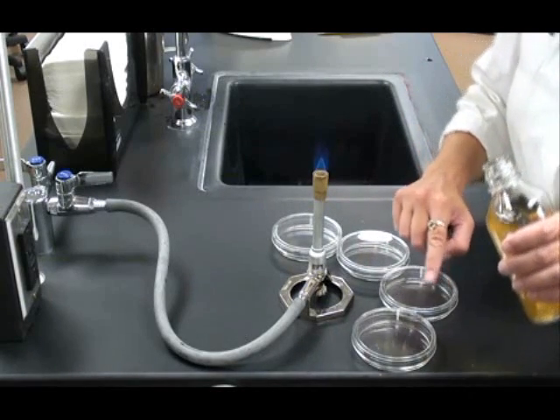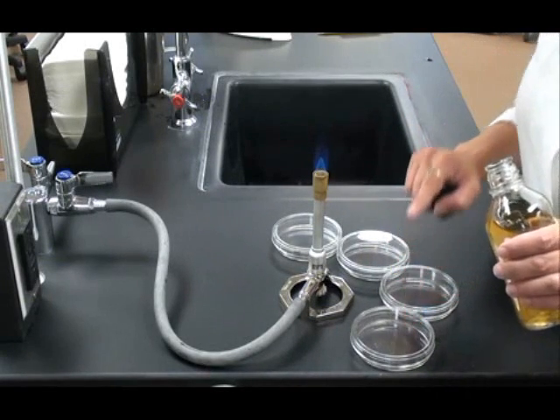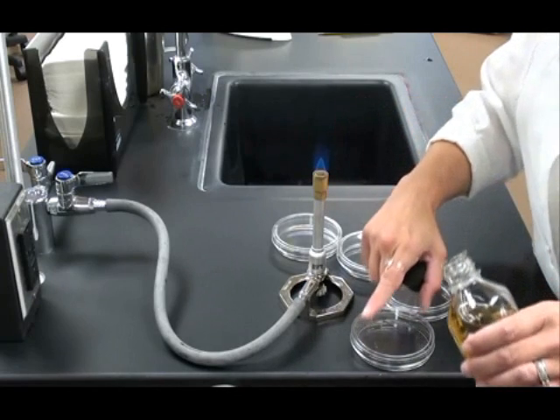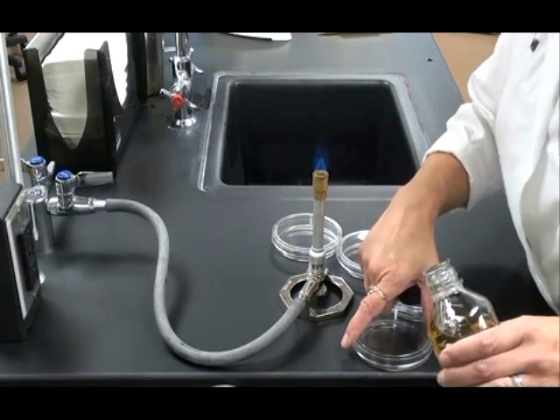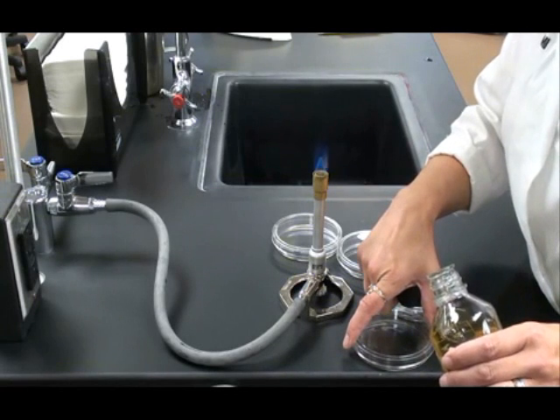Make sure your petri dishes are located as close to the Bunsen burner as possible in case you need to re-sterilize the neck of your bottle. You can pour about three or four plates before you need to run the neck of that bottle through the flame again.